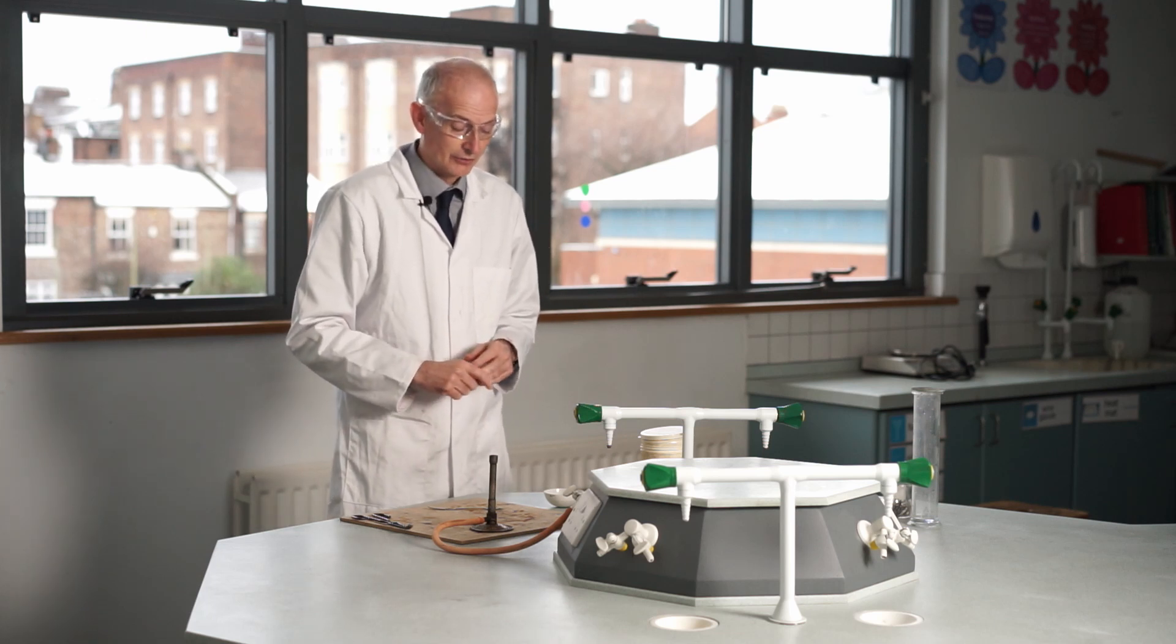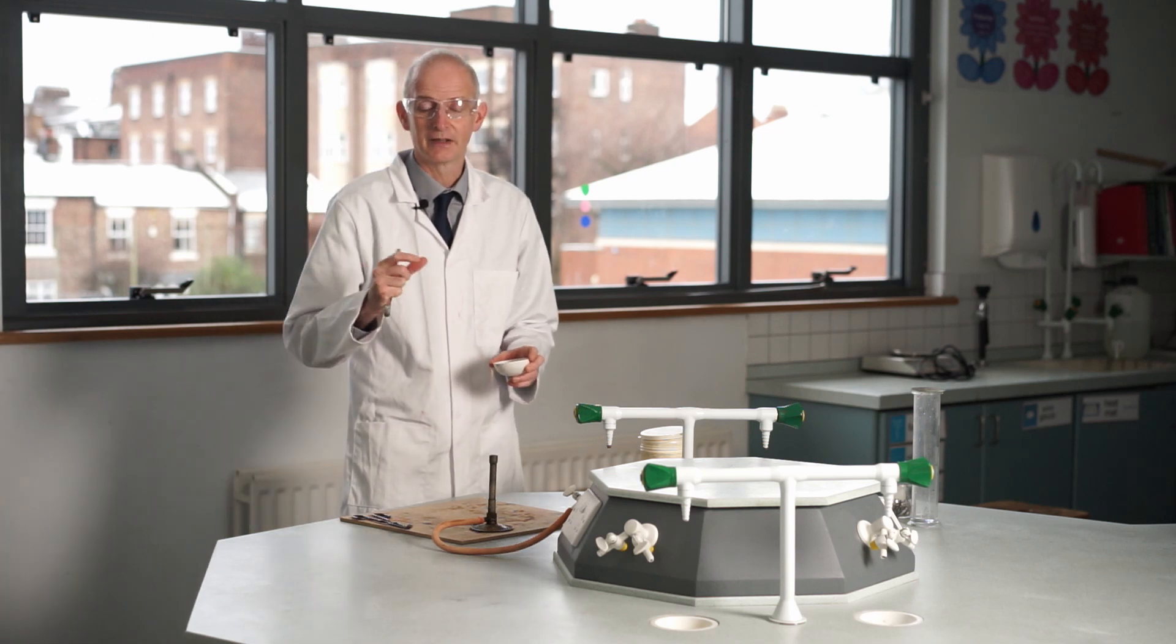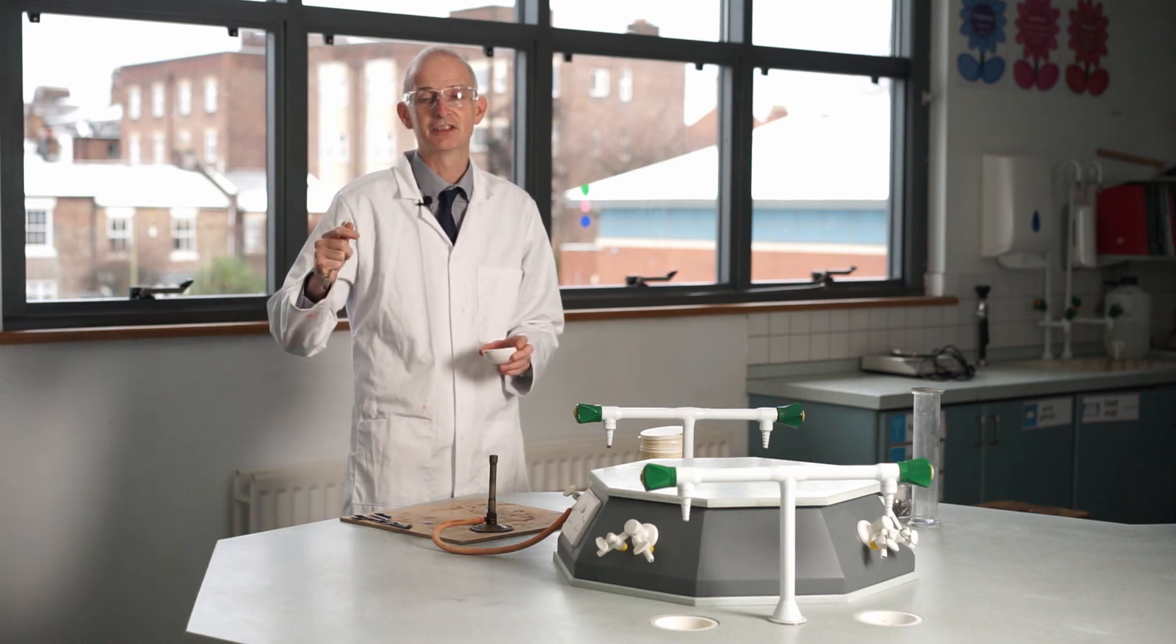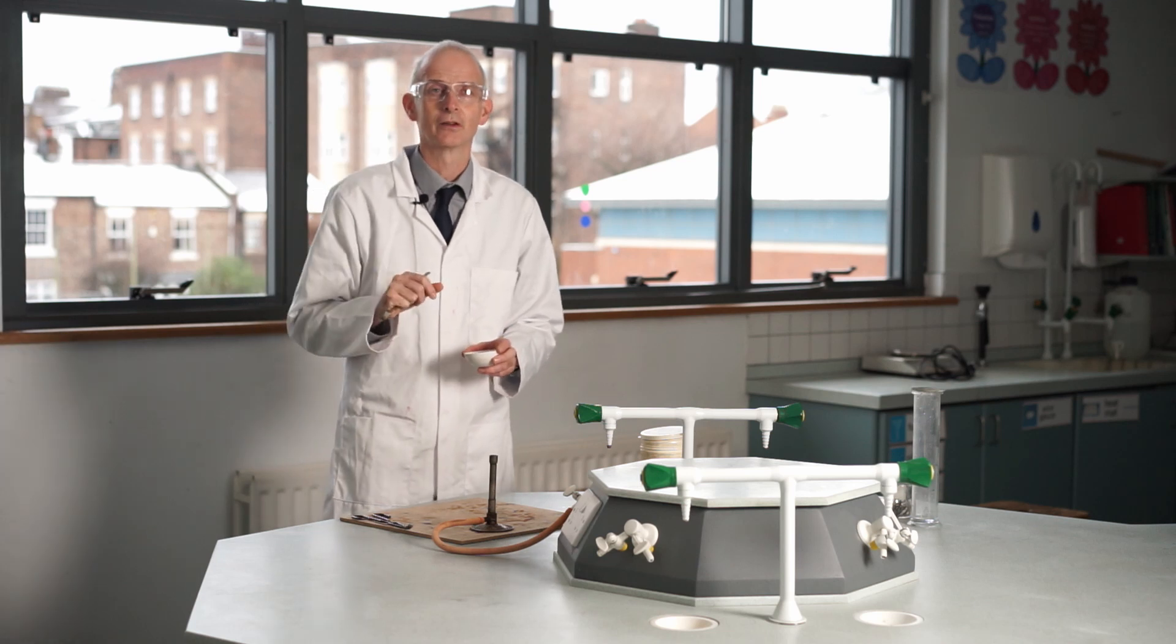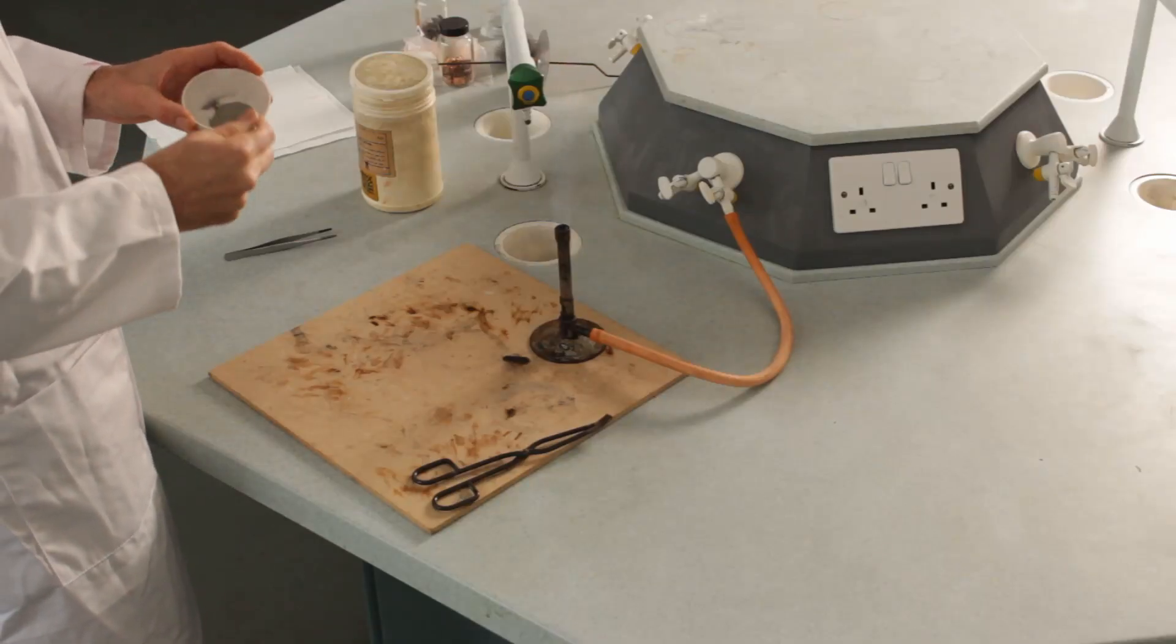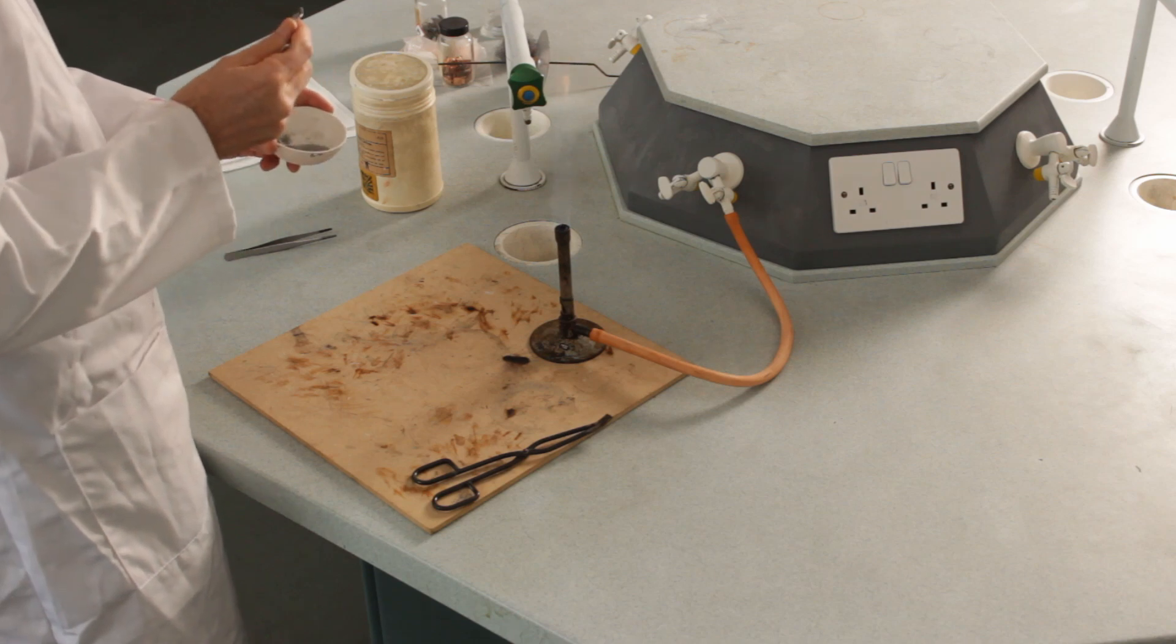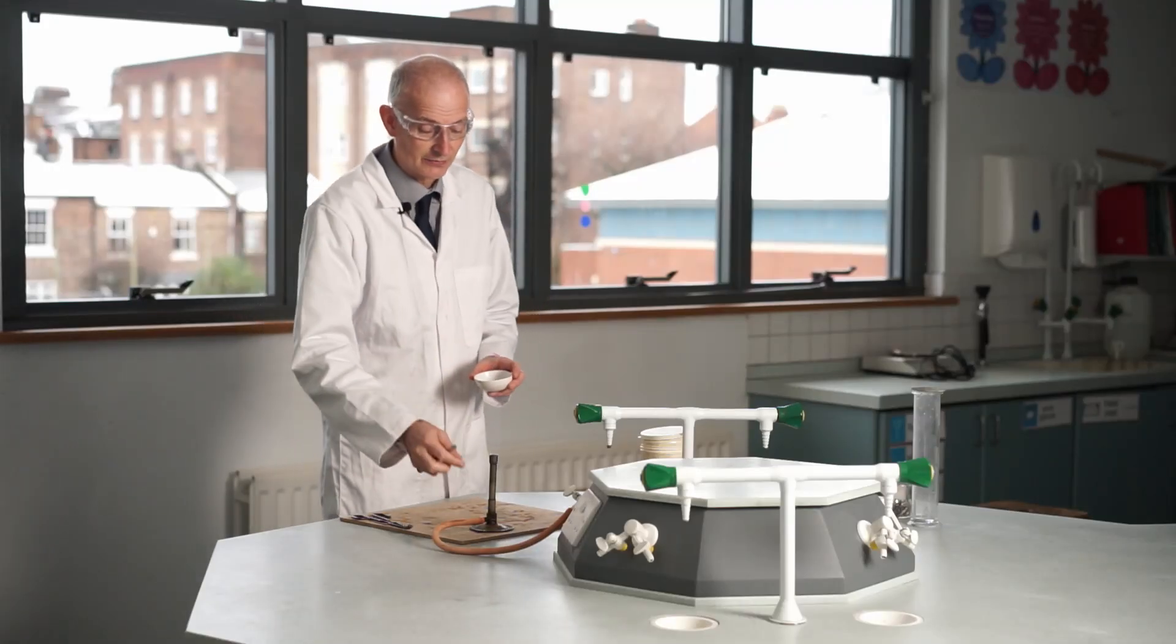I'm going to show you what happens with zinc. I've got zinc powder here. Zinc comes in various different forms—you might see zinc outside if you look at lamp posts and things like that, they've got a lovely pattern on them because they're coated in zinc. But this is very finely divided zinc, like very fine sugar, and I'm going to heat it.